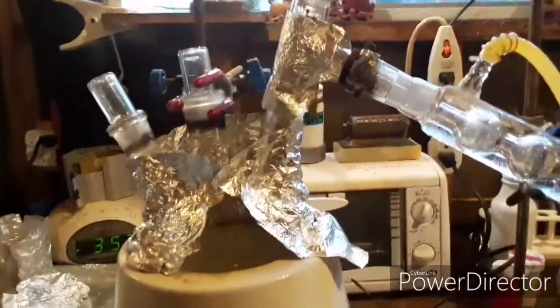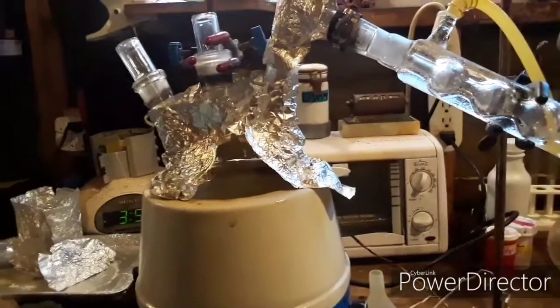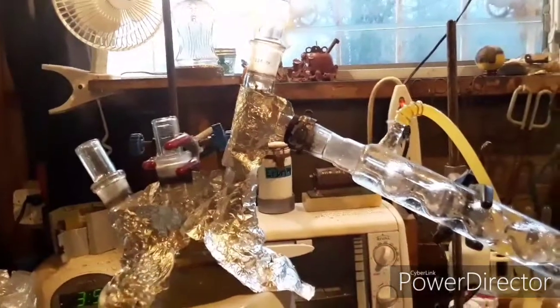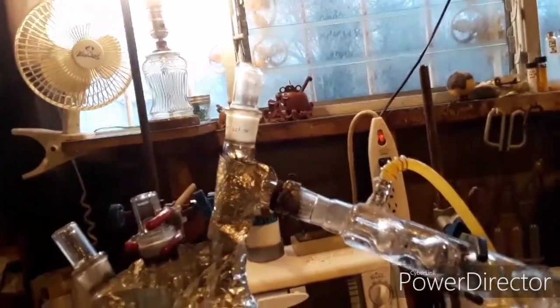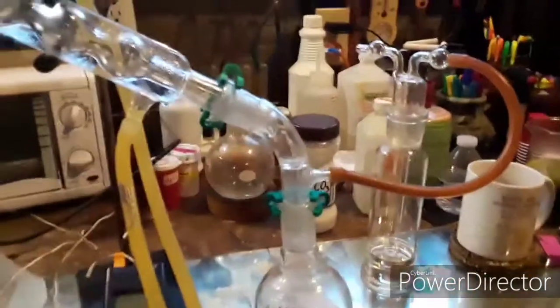These two stoppers were seized up on me, so I had to pull out my thermometer, wait for it to cool down, and throw some boiling chips in. Just stick those in beforehand — especially if you're going to use a flame — and you won't have to worry about recovering from an incident like that. I was lucky this joint wasn't fully seized because everything was already hot and I couldn't really take a heat gun to it.